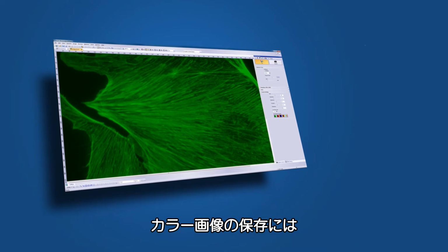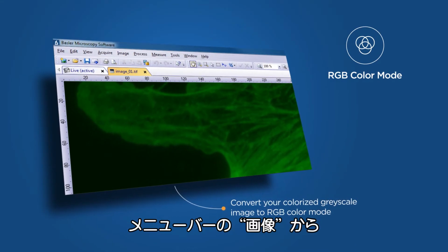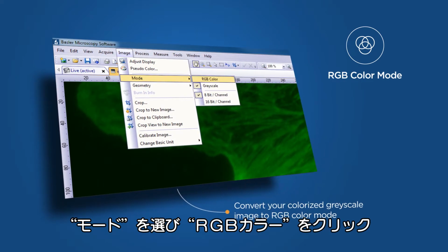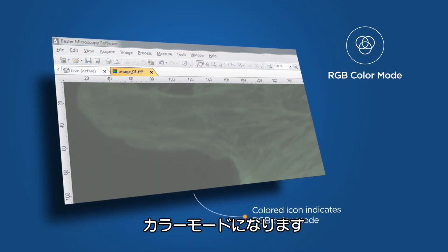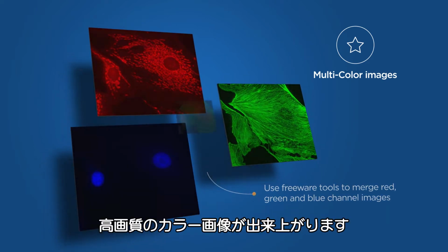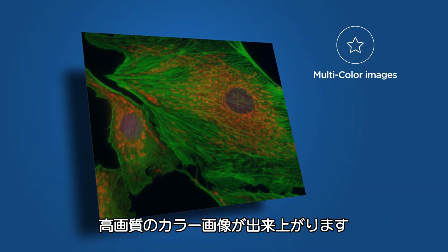For saving a colorized image, you simply need to convert your image to RGB color mode. Choose Image from the top menu, then Mode and click on RGB color. Now, as indicated by the Color tab icon, you are working in color mode. Freeware tools can be used to merge red, green and blue channel images. The result is an impressive color image taken by the Basler microscopy software.